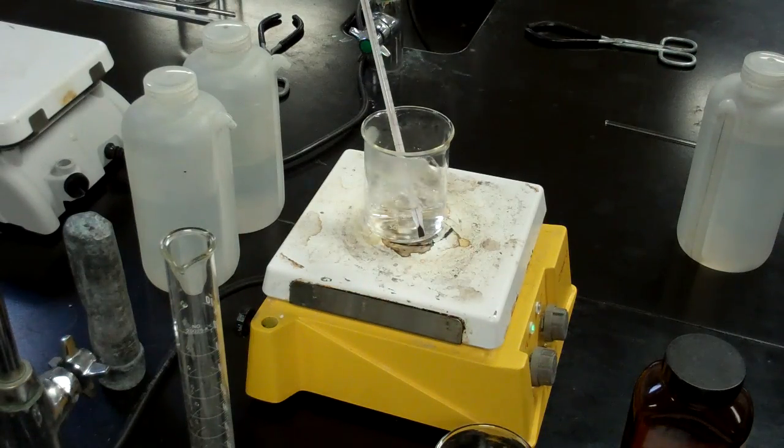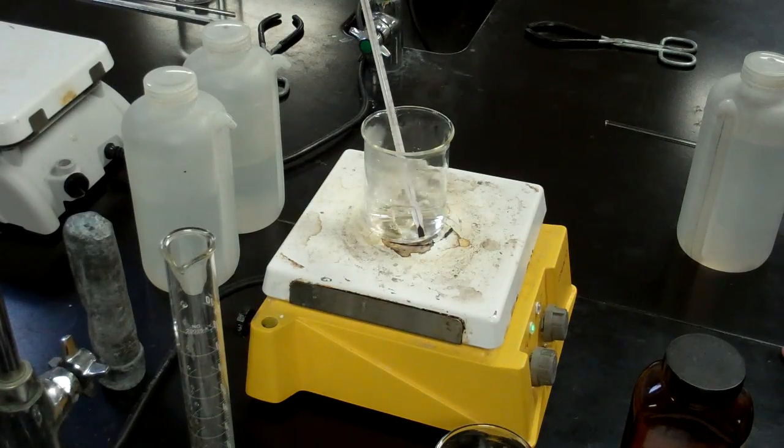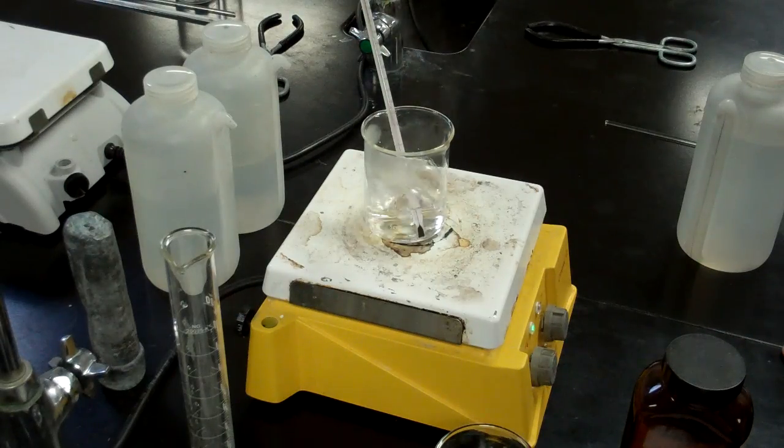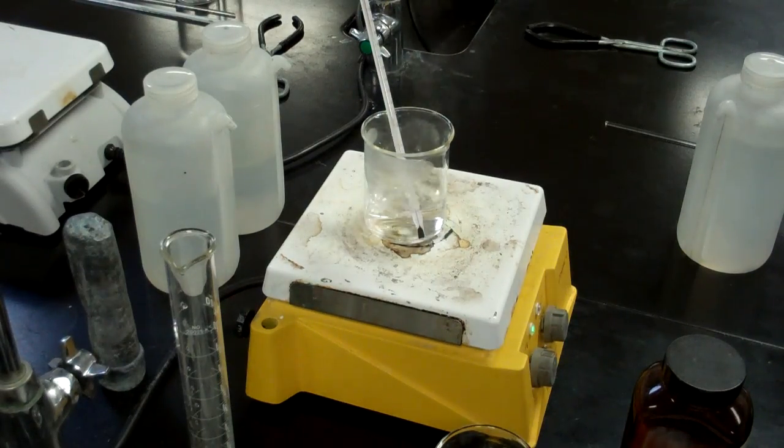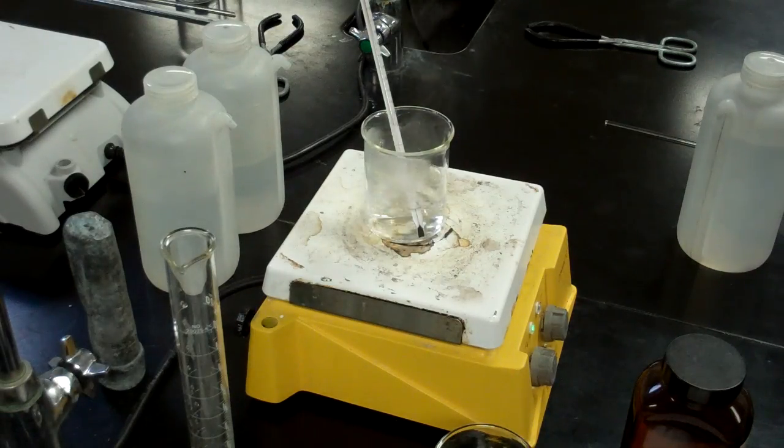We're going to find the role that a solute has in changing the boiling point of the solvent. The solvent we're using is water. So it's a pretty straightforward lab, pretty easy to follow.